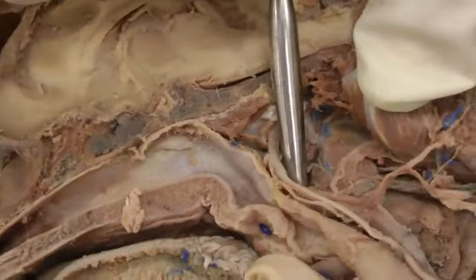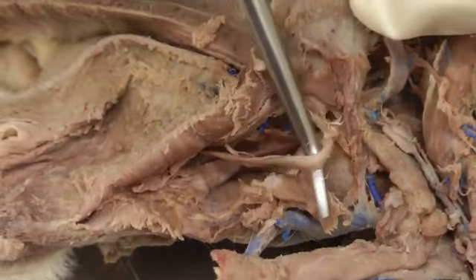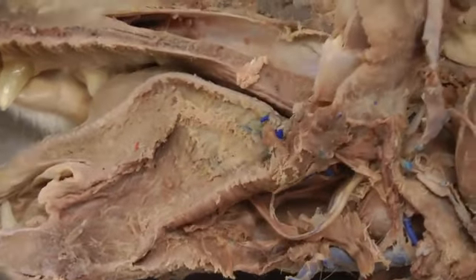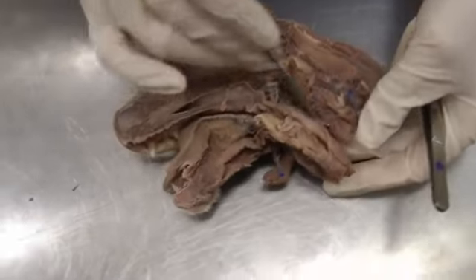And then we'll follow that down, and you can see it from that ventral view, and it's the nice big one coming out here. So that's hypoglossal nerve. That should be it on the nerve section, and we'll move on to the cervical structures that you should know.